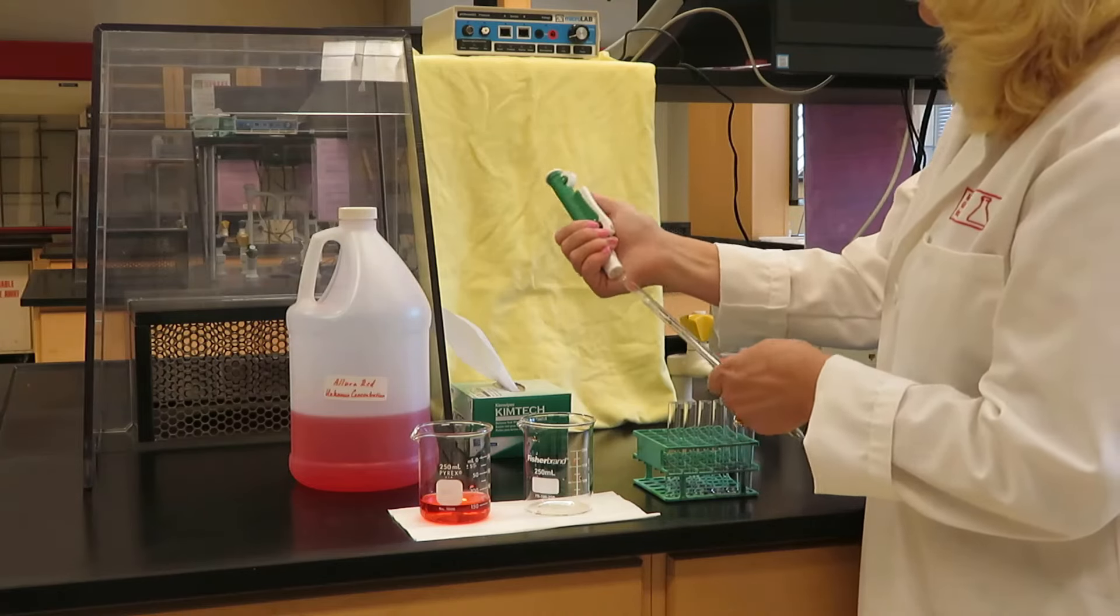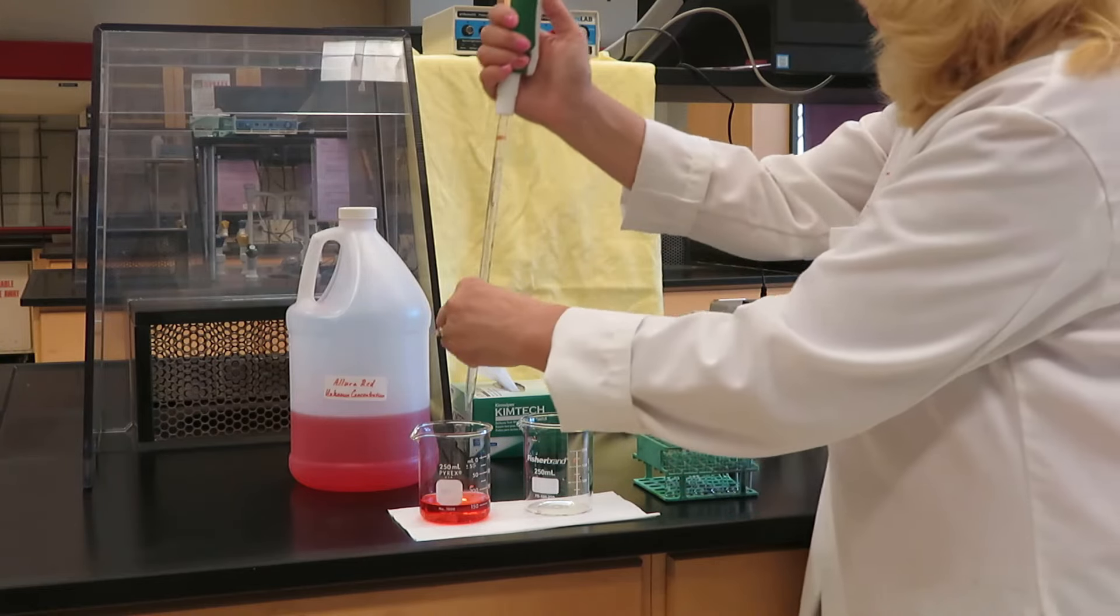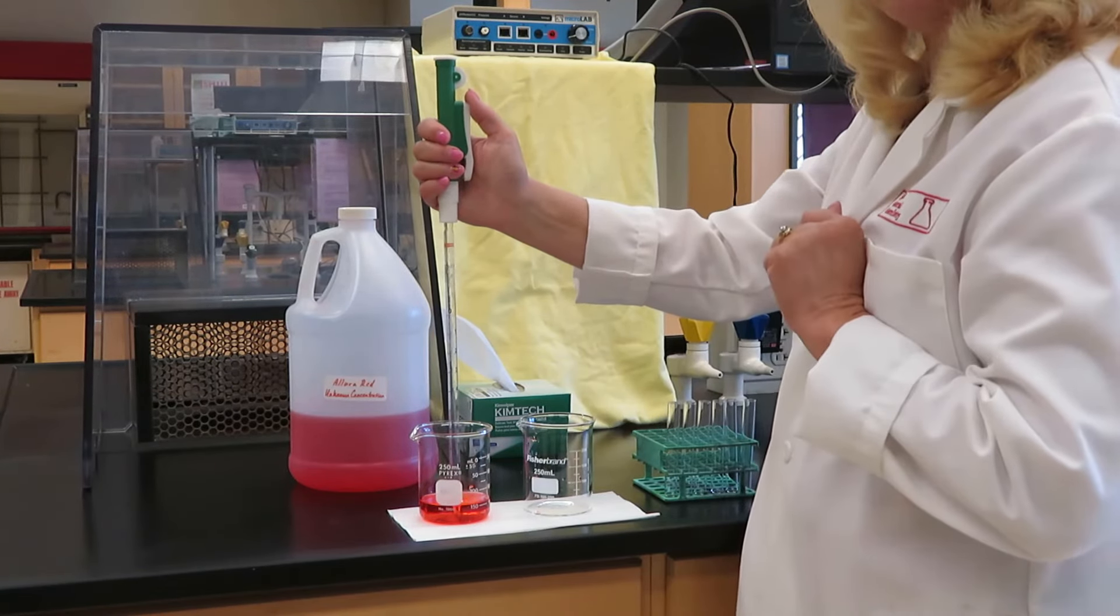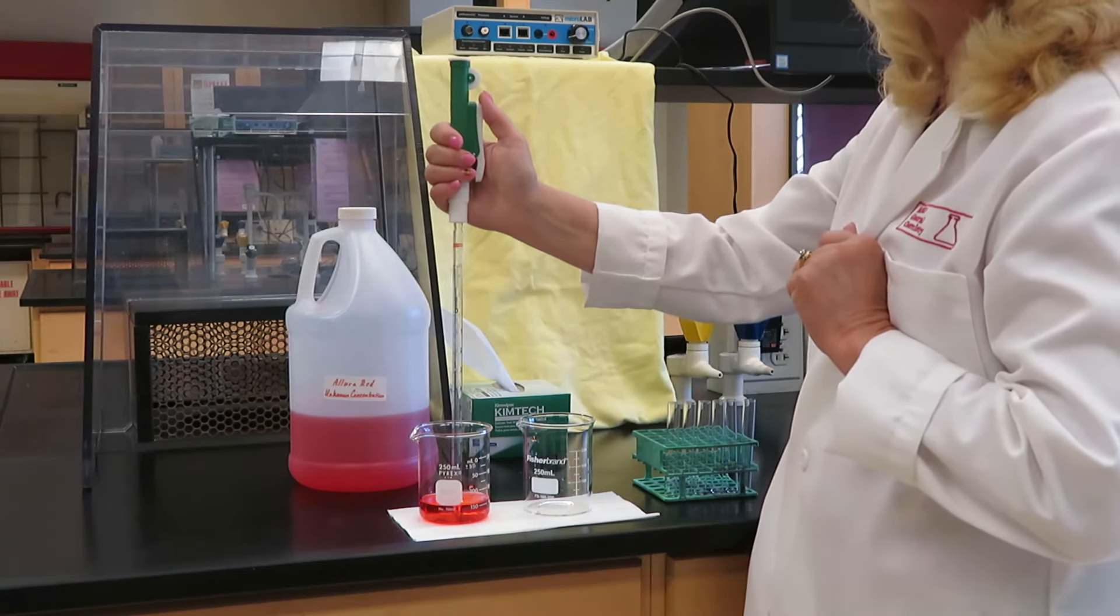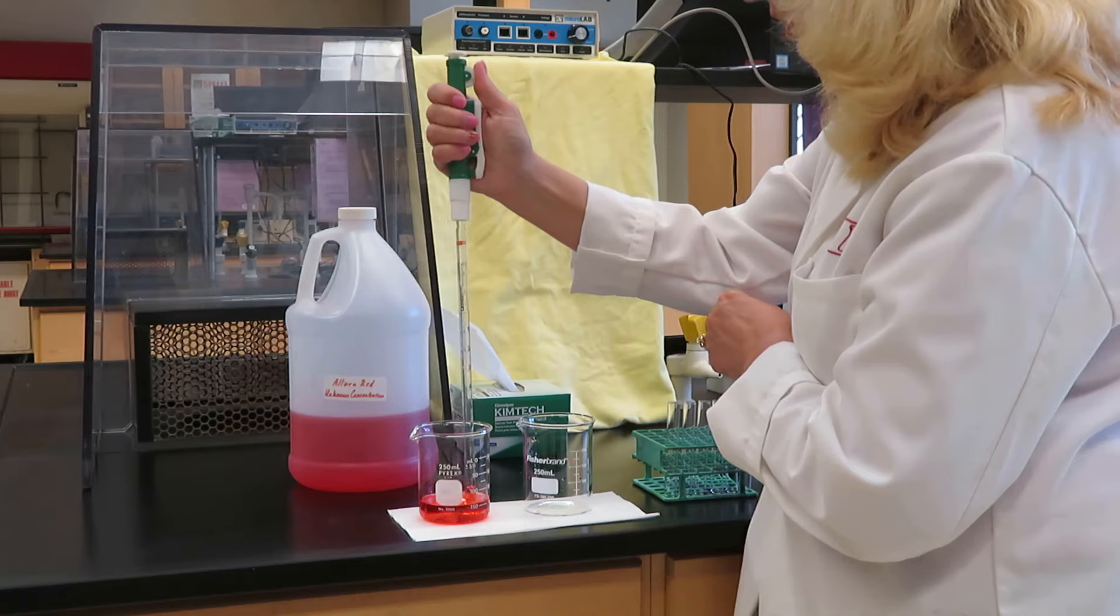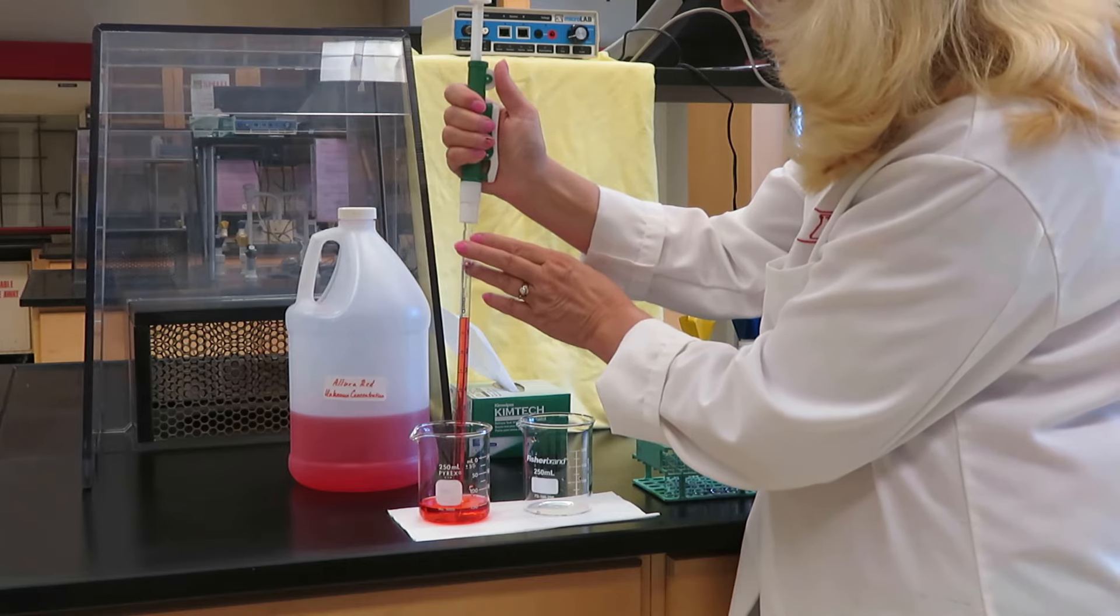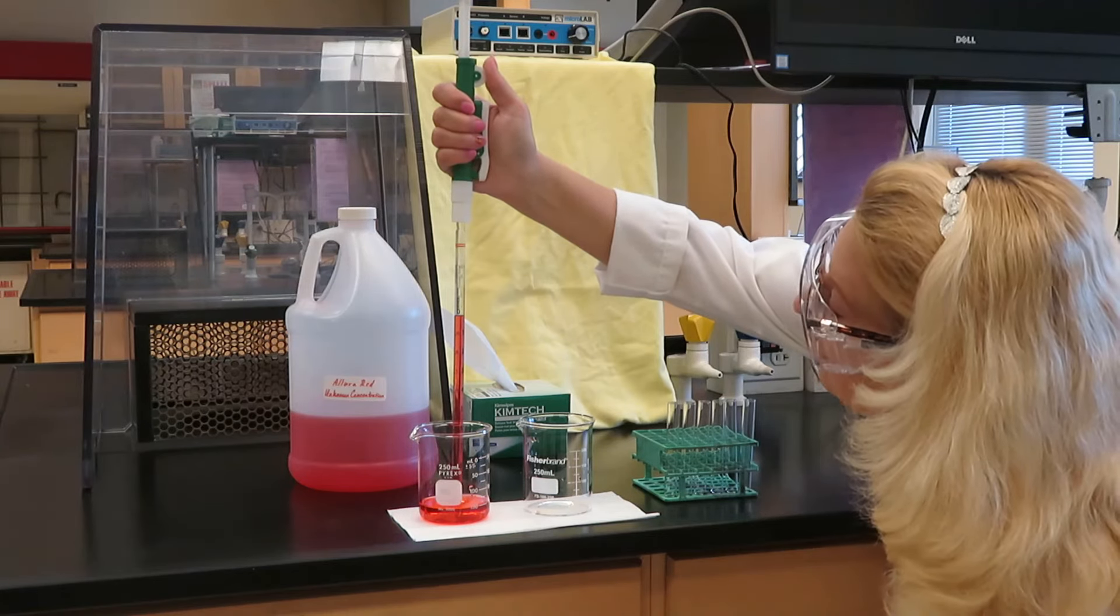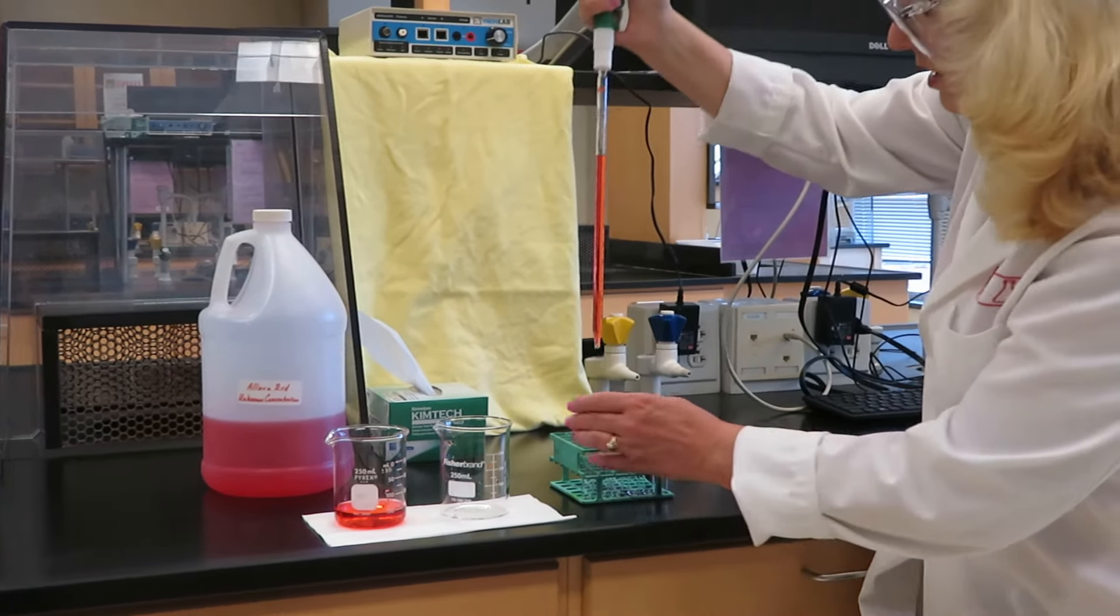Once again, I'm going to place my filler very firmly on the end of my pipette. For speed, let's say that this pipette has already been conditioned. You, of course, if you were using it in the lab, would condition it first, but I will get right to filling. Once again, I'm going to roll downward with my thumb, and I will get precisely to 0.00 milliliters.